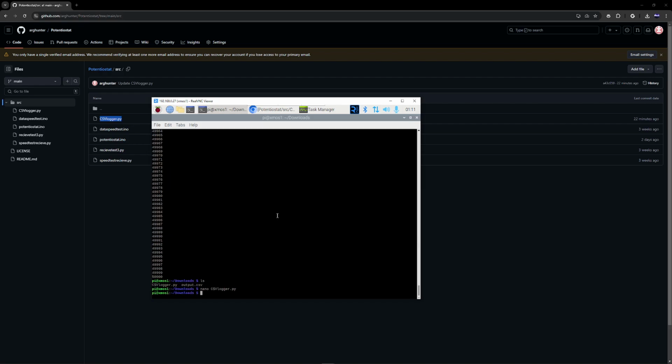Now, the first thing you have to do is figure out what serial ports the Teensy is using. You do this by running this command, python -m serial.tools.list_ports. As you can see, we have 3 ports found so far. And typically, if you see 2, where one is labeled 0, one is labeled 1, those are the 2 ports that the Teensy is using. The lower port, ACM0, is used for reading data from the Teensy. The higher port, ACM1, is used for sending commands to the Teensy. And that's just for simplicity.